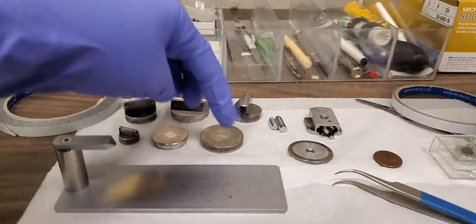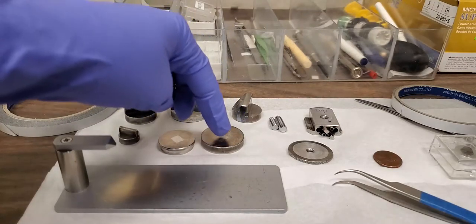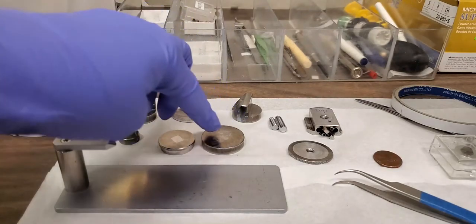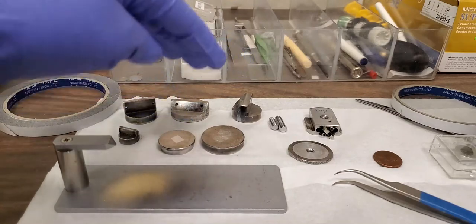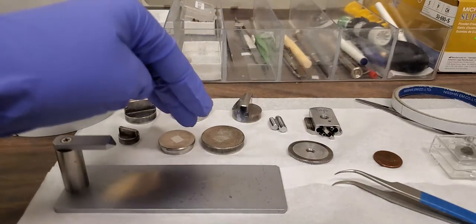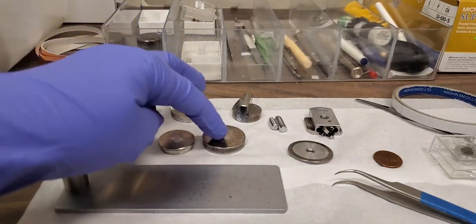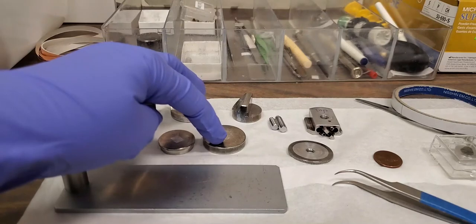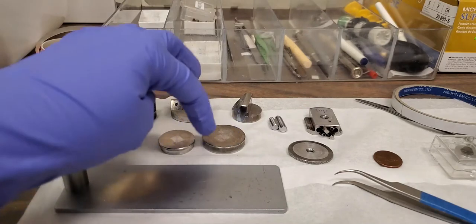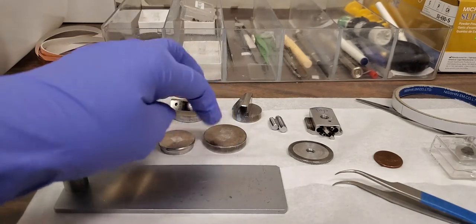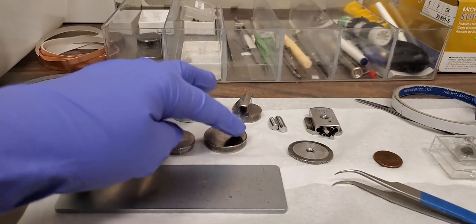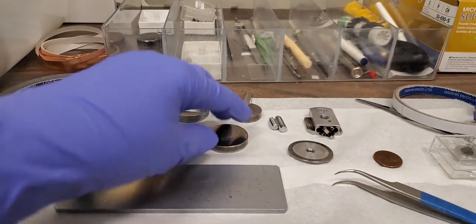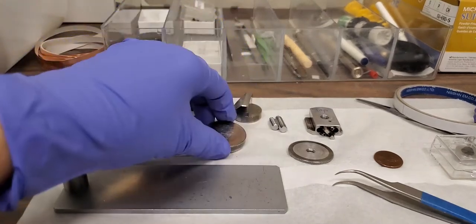These are for flat samples where you're interested in just laying the sample flat and looking at the top surface. You might choose a different size, either your sample is actually this large, or maybe you have multiple small samples. In that case, it's okay to mount more than one onto one of these large sample pucks.